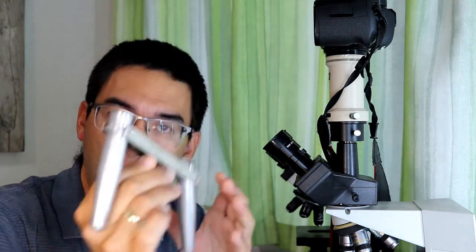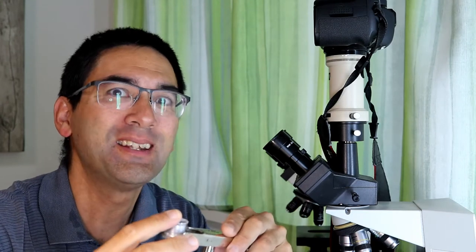And then this concentrates the pollen and then I can actually, I hope to be able to do this at least, and then I can observe the pollen under the microscope. And this is what I'm going to show you now in this video.